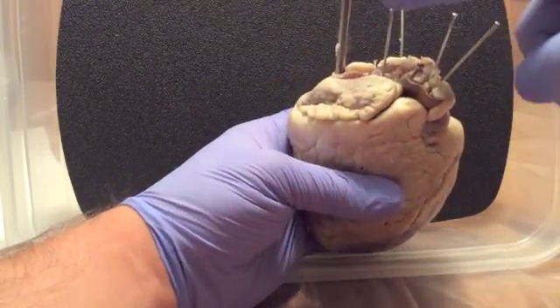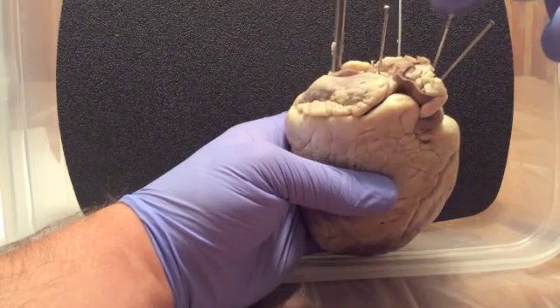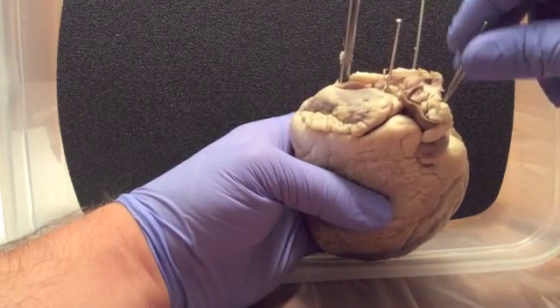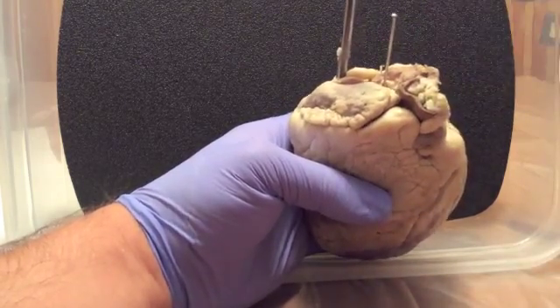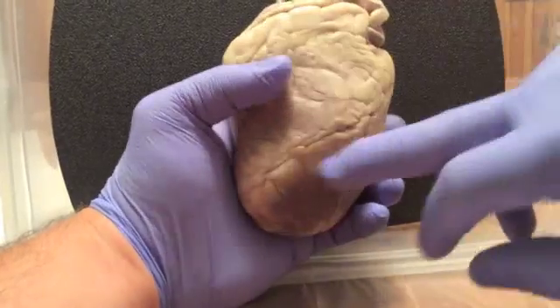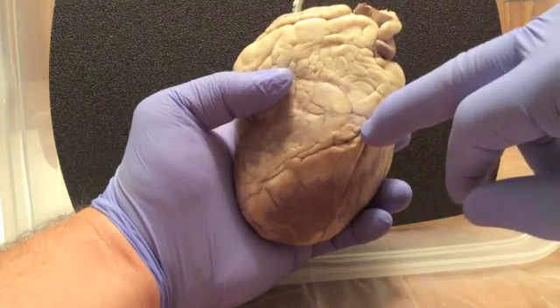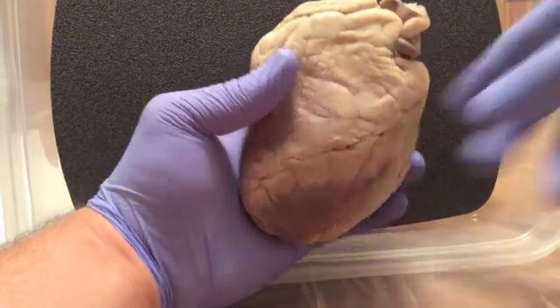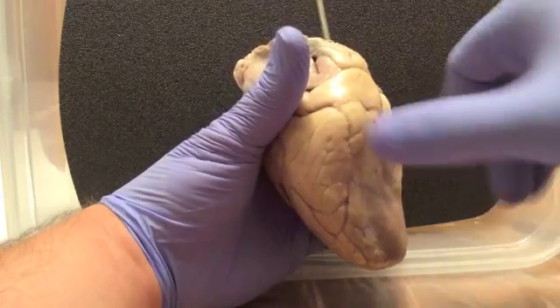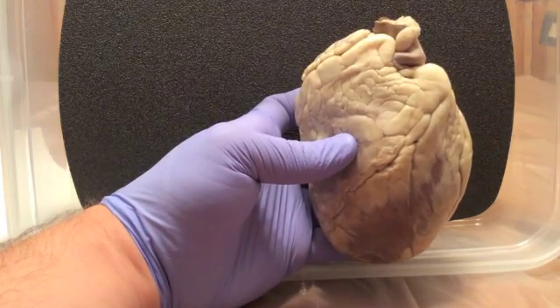Up here on top, we already pointed out the vena cava. Then we have the brachiocephalic artery, the left common carotid artery, and then the left subclavian. So that points out most of the anatomical structures that we have on the exterior of the heart. The back here, or the main arteries that are in the sulcus, is the right coronary artery, and then the left coronary artery, which leads to the back here. So those are the main arteries that kind of go into the sulcus here, or the divisions of the arteries, or the ventricles.